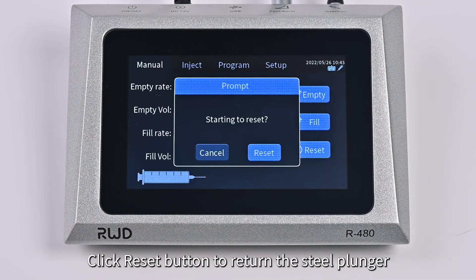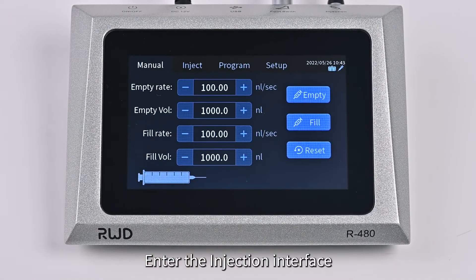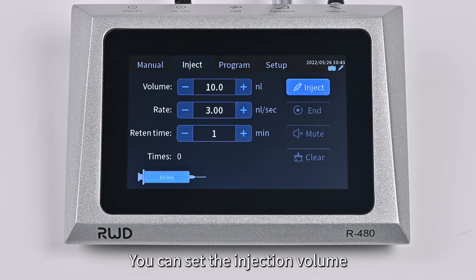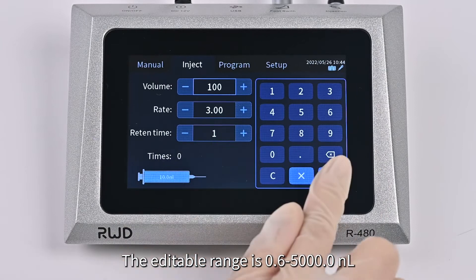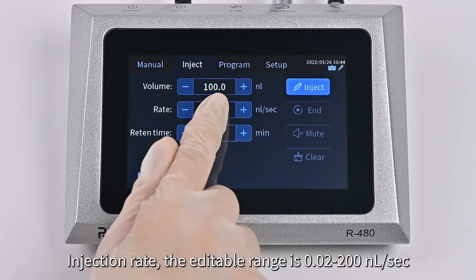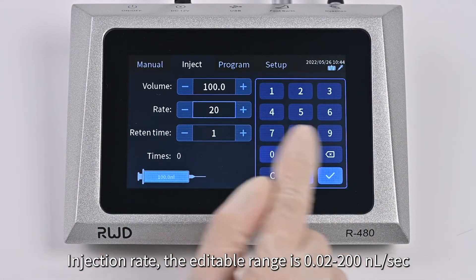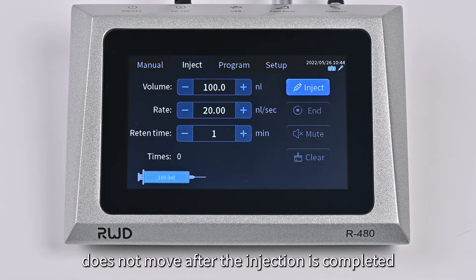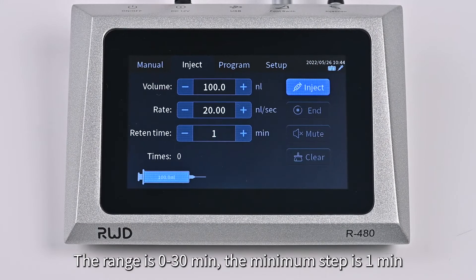Click the Reset button to return the steel plunger to the initial position. Enter the Injection interface. You can set the injection volume; the editable range is from 0.6 to 5,000 nL. Injection Rate: the editable range is from 0.02 to 200 nL per second. Retention Time indicates the time that the steel plunger does not move after the injection is completed.